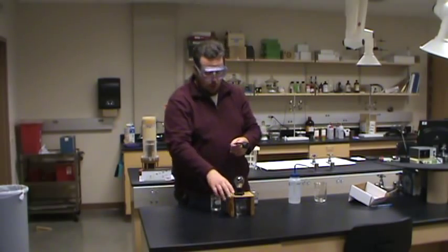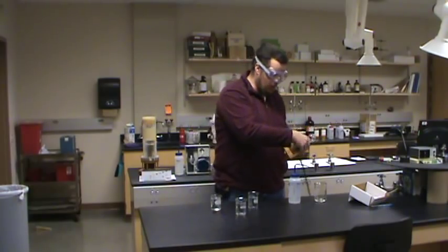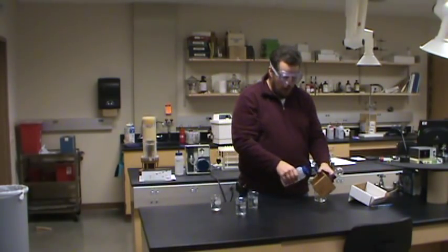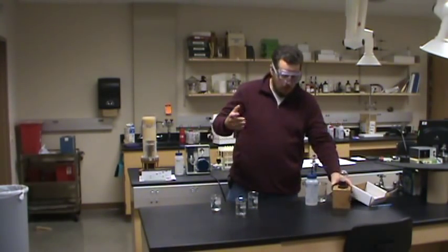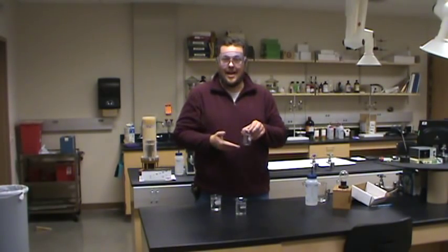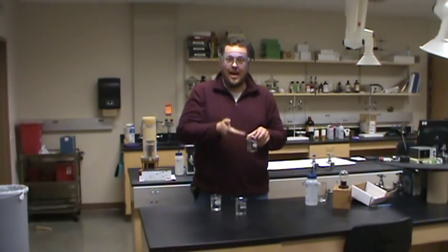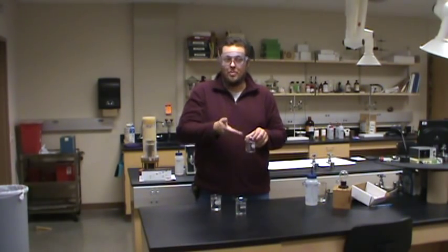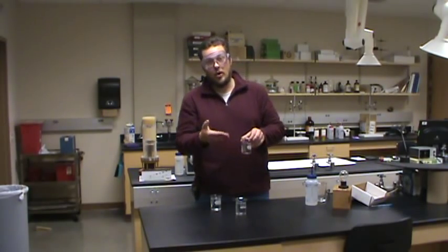Make sure that when you're doing an experiment — any experiment — you are using proper water, a proper blank. The reason this experiment works, the reason we can get useful information out of it, is because we can trust that deionized water truly is blank. It does not have any appreciable conductivity compared to the other solutions we're measuring, so make sure you're always using the correct blank, the correct water.